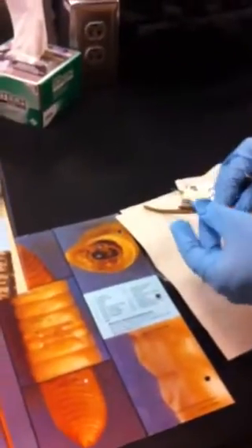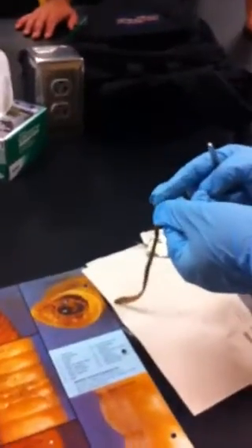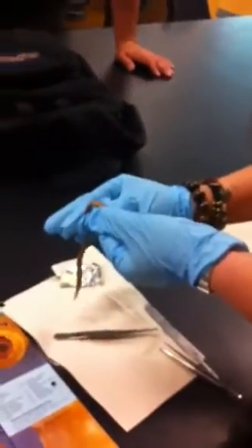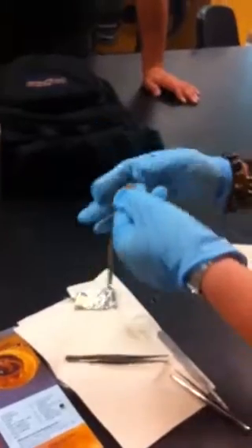Okay, so if you look, the other thing that you guys are going to see here, which is kind of cool, they're actually hermaphrodites. Kind of cool, huh? So where is the sex part? It's actually right here on that little, that. Yeah, that's also where your ovaries as well as the testes are. But they can't self-fertilize. They do need another one. And it just cracks me up because they do it opposite. Okay, so what's that mean? If this is one going this way, the other one has to go the opposite way.